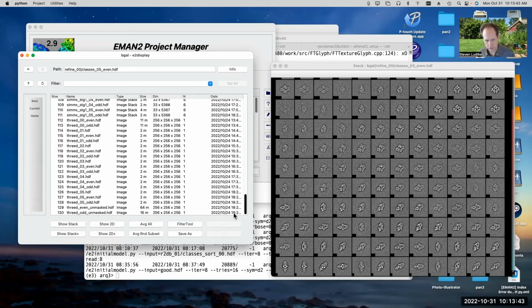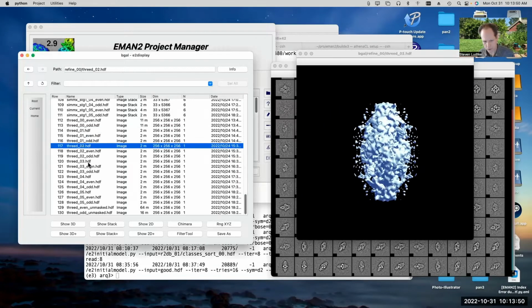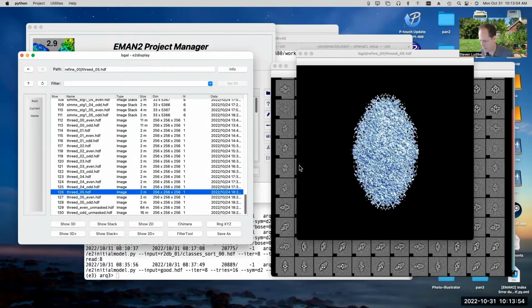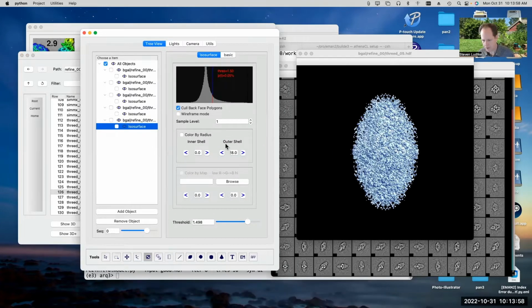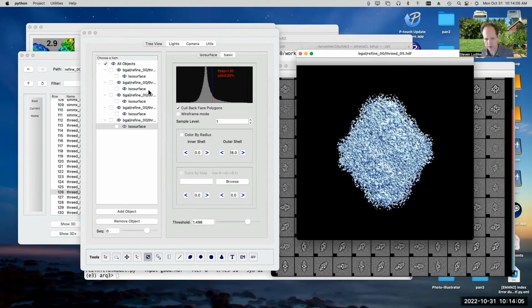All right. So if we want, we can open the 3D models in sequence. So 01, 02, 03, 04, 05. So they're all loaded together now. Now I'd like to adjust the ISO surface so it's not showing us quite so much noise.